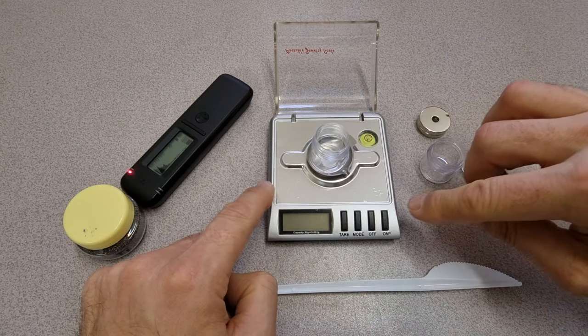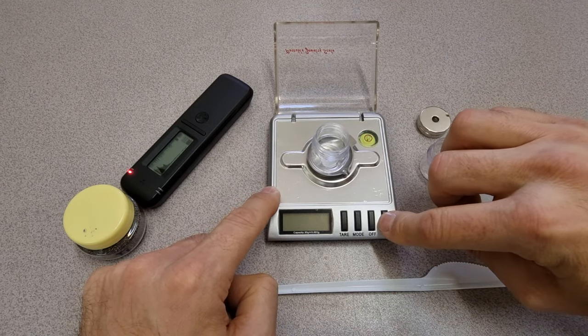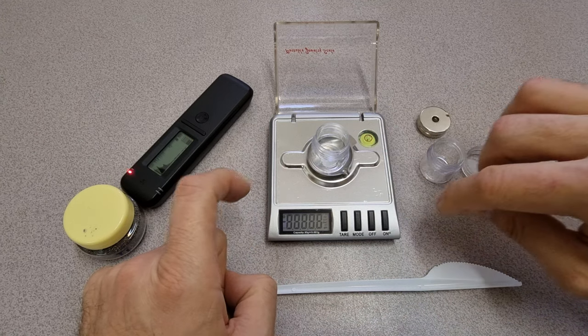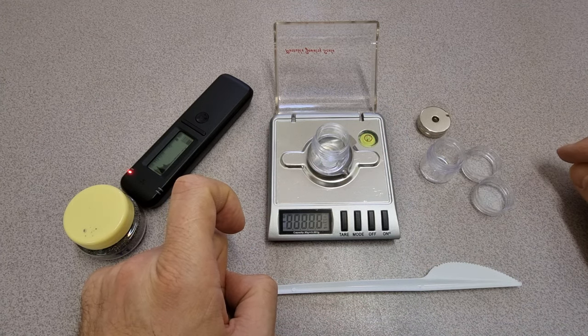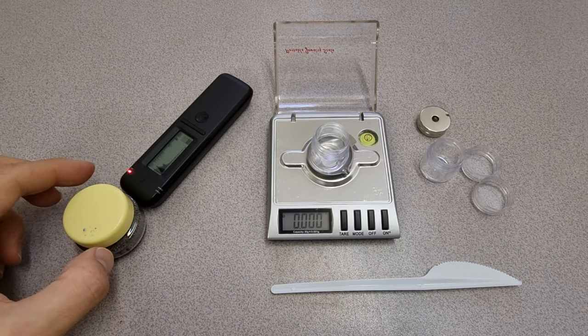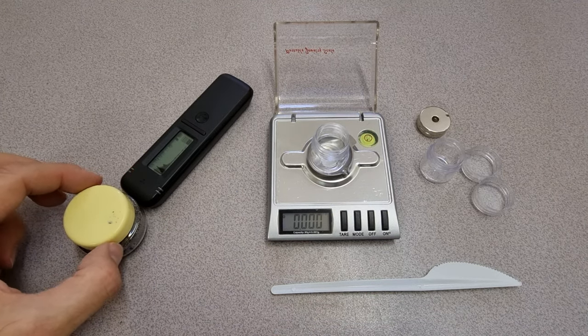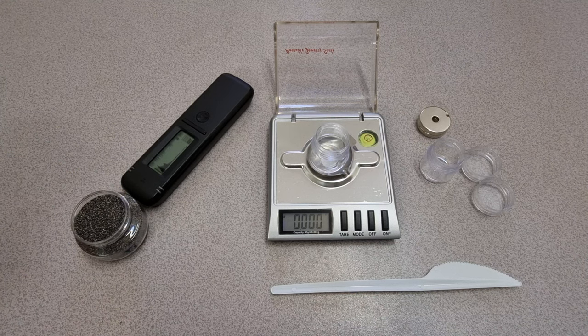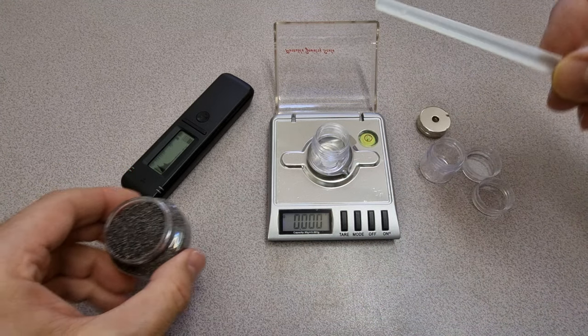I'll put it on here and let it settle. It kind of auto-tares when it goes on. I've kind of pre-partially screwed this off. I don't want much.